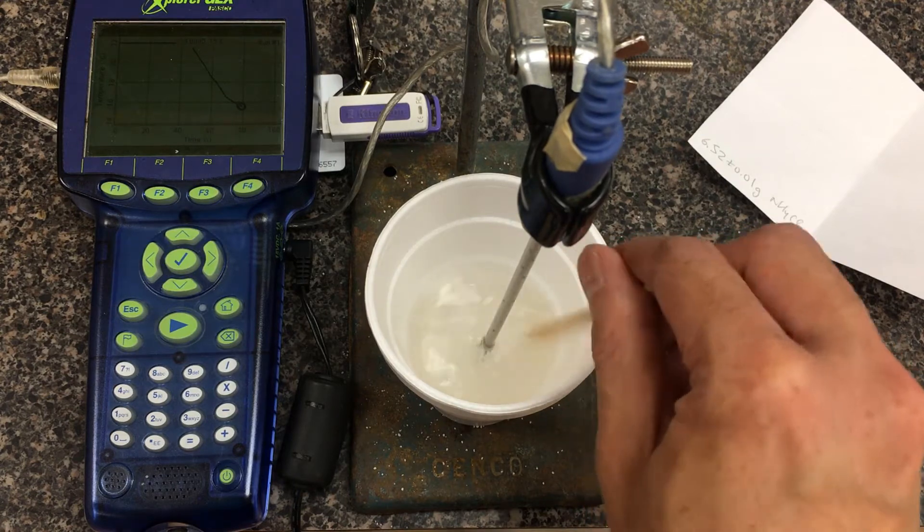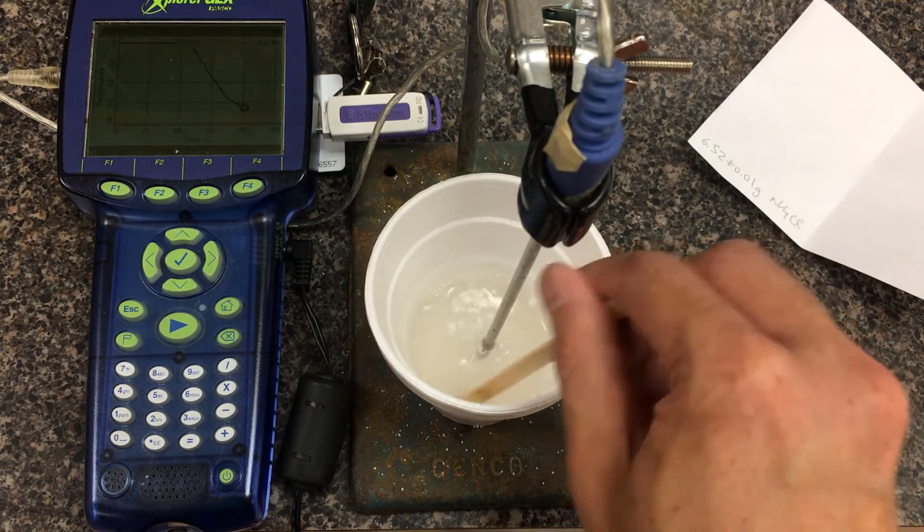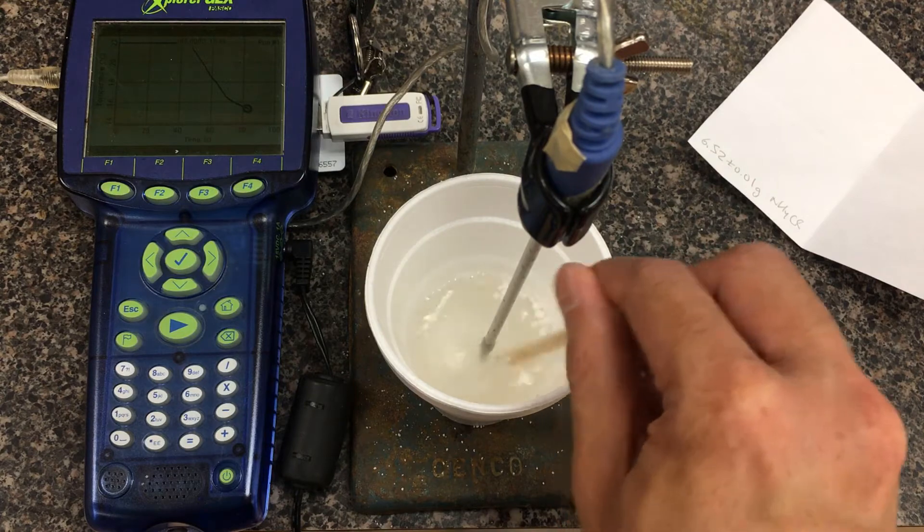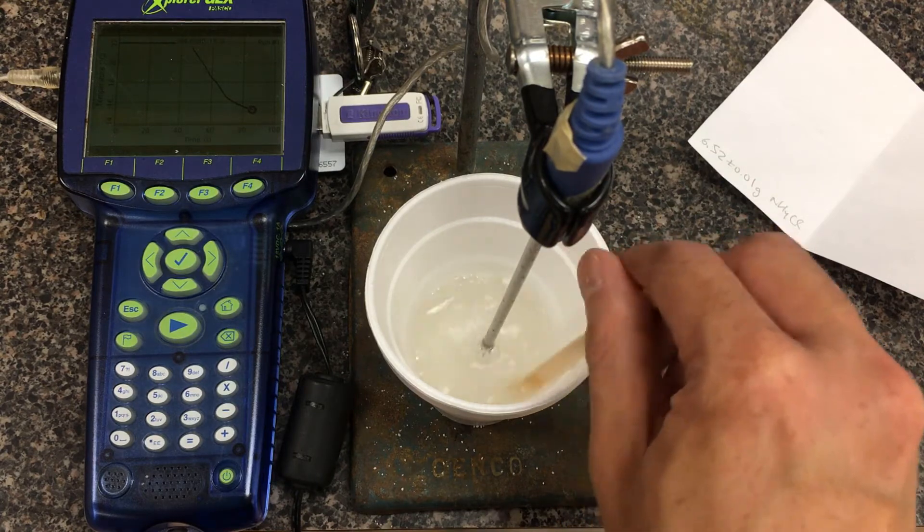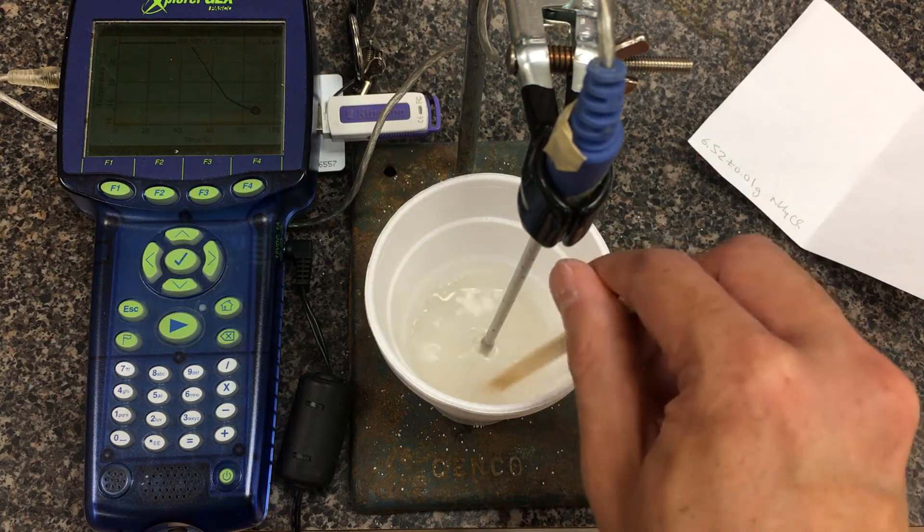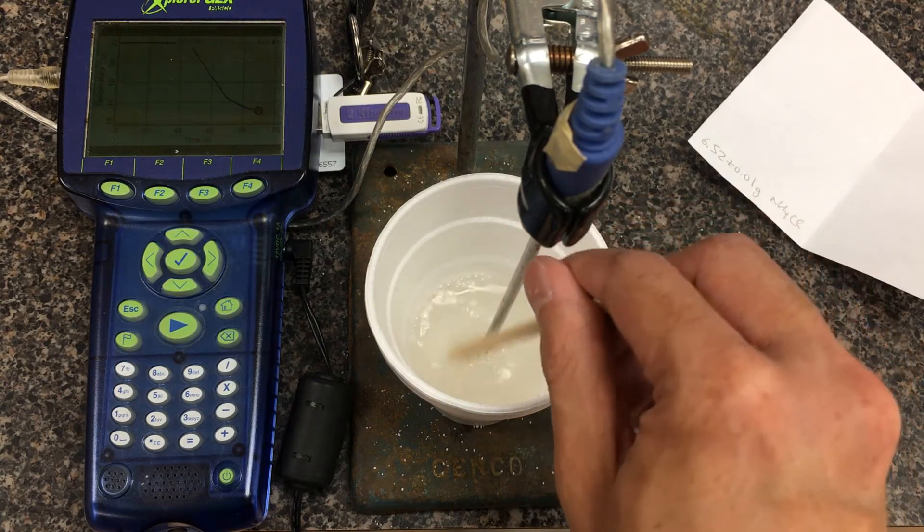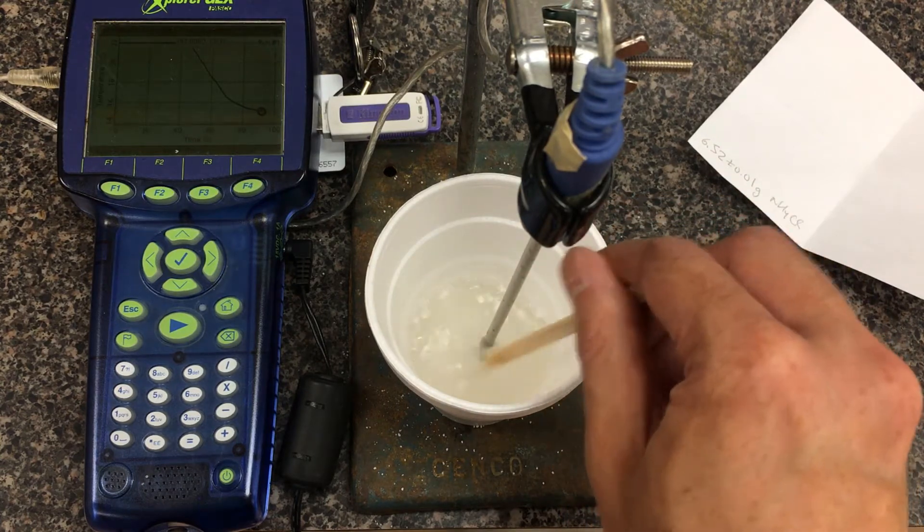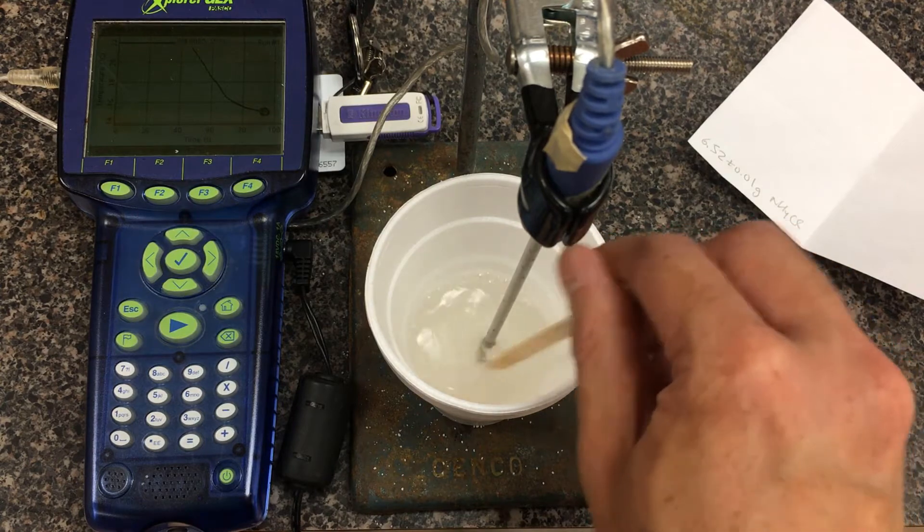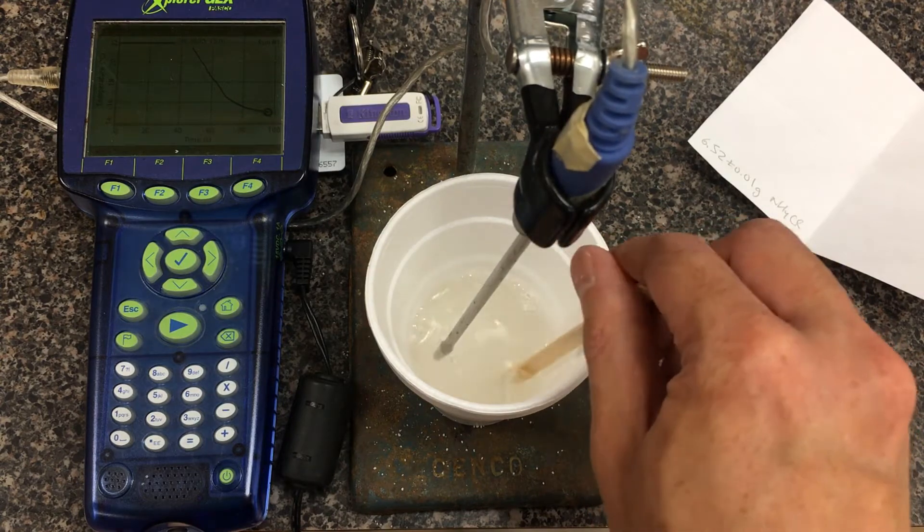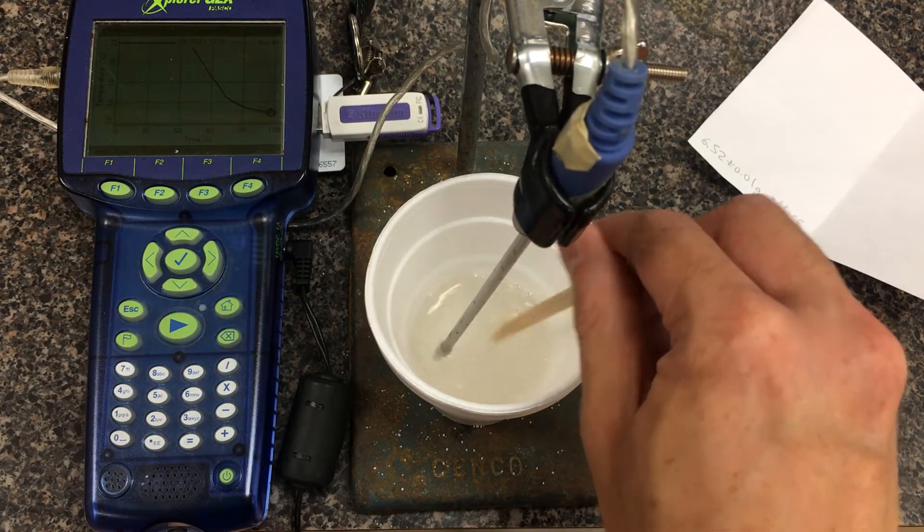Eventually we're going to export this graph. Even though it's taking about 60 seconds for the reaction to finish, we're going to be doing some extrapolation and trying to figure out what minimum temperature this would have hit if the reaction had happened all at one time instance. I'm just going to let this keep reacting.